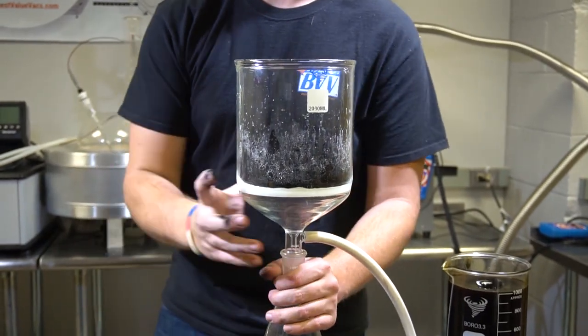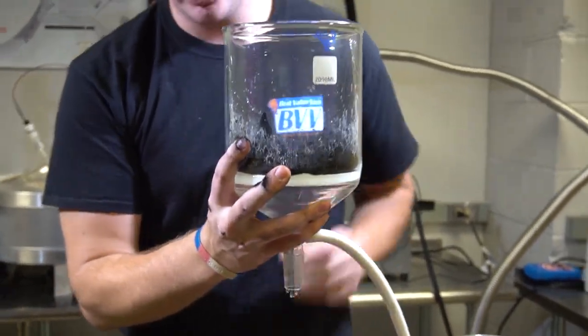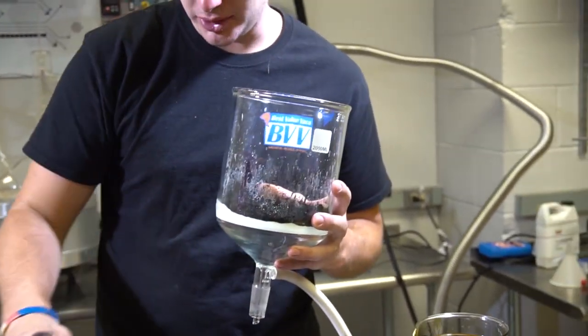Now we're going to put some more ethanol in to flatten the activated charcoal layer. Reuse the same from earlier.